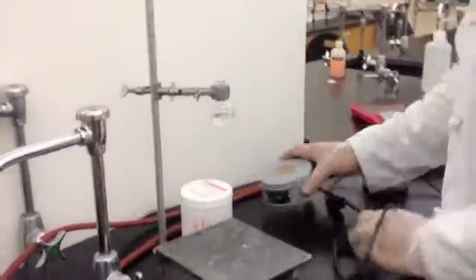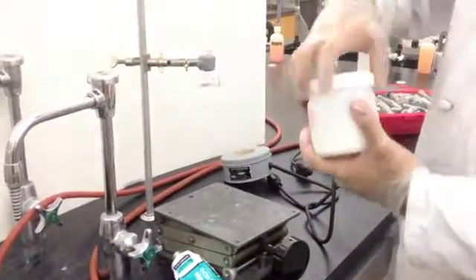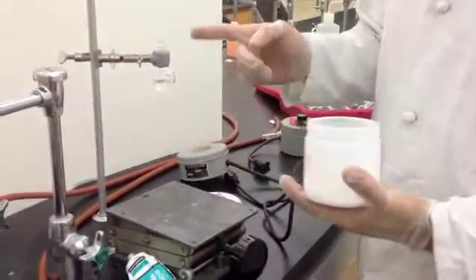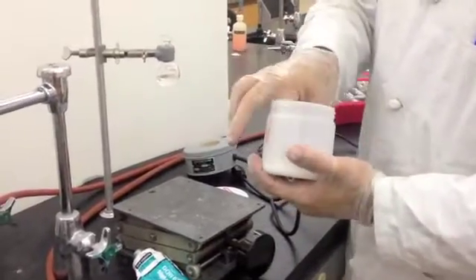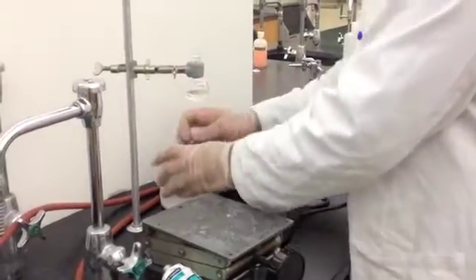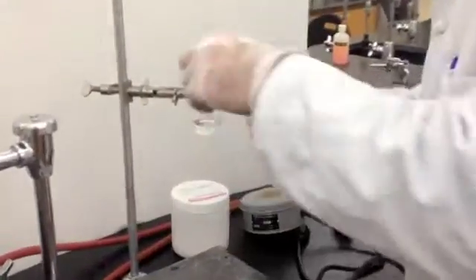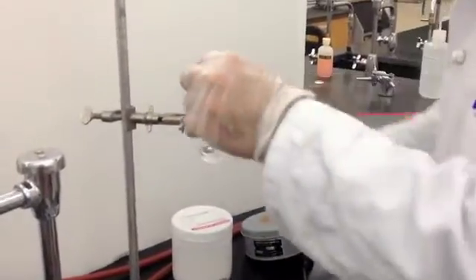You will put a boiling chip for gentle reflux, gentle boiling actually, inside the round bottom flask. There we go.